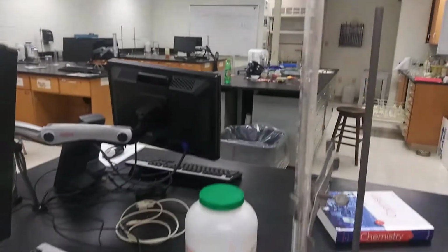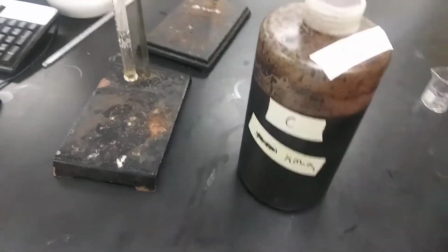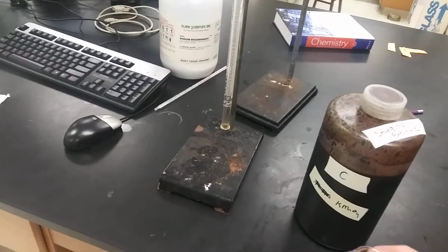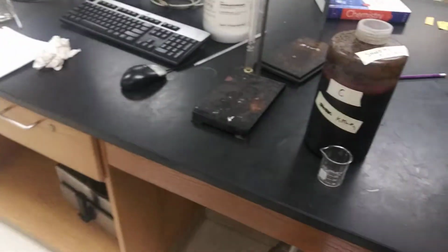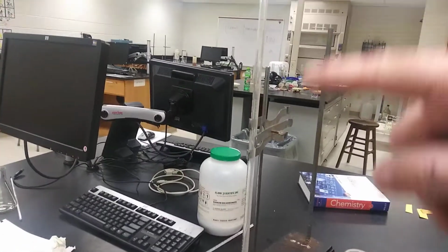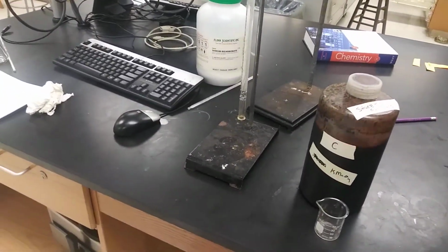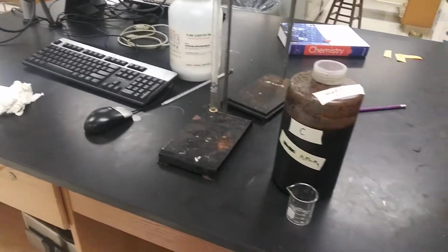So just so you know, make sure you write down, or make sure you use consistently the same bottle. There's typically a small jar next to it where you can pour into. And while this thing is heating, get this thing filled up. It's not uncommon for me to see people just standing around watching their stuff heat and nothing is ready. So make sure you're doing that.